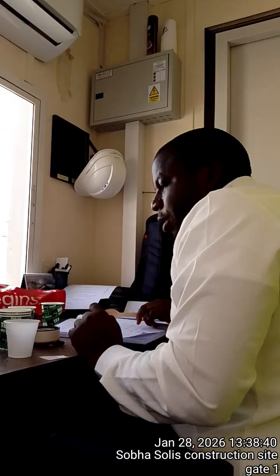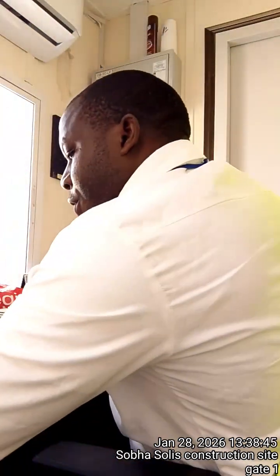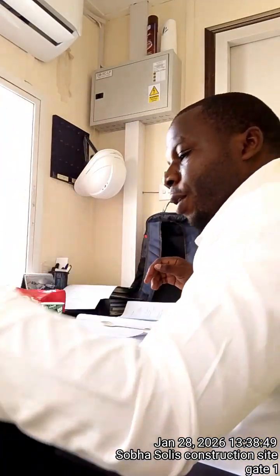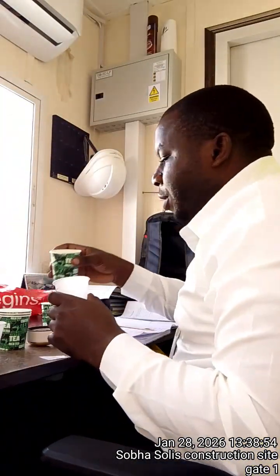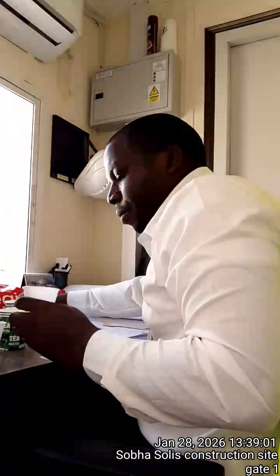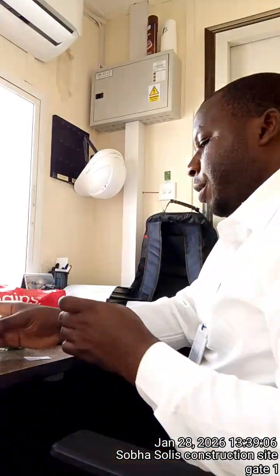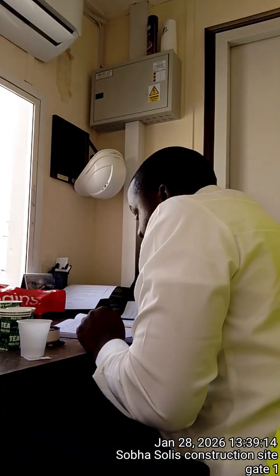So let's begin. Here in my procedures, they tell me to put some equal amounts of water. Some, not too much, about 10 mils, 5 mils. Don't fill it too much. Just, yeah, this is enough. Then I'm going to add this. So I have tap water, I have drinking water. This one, tap water, is always marked.